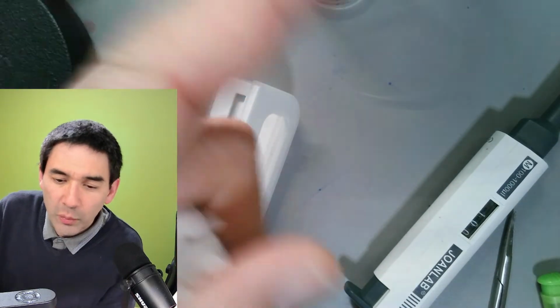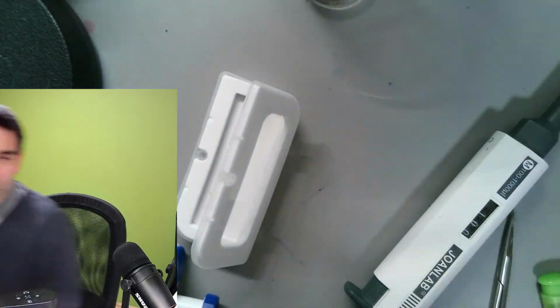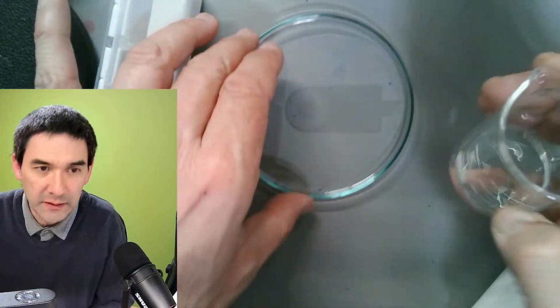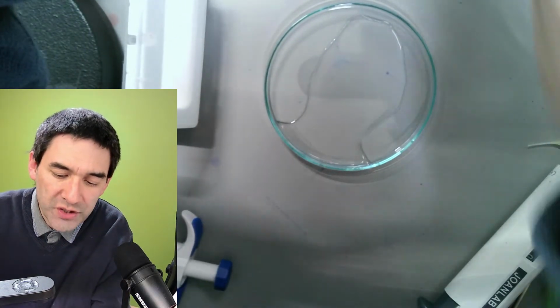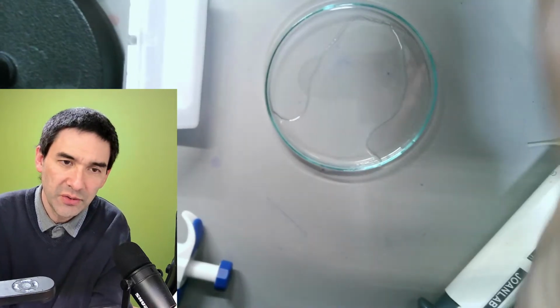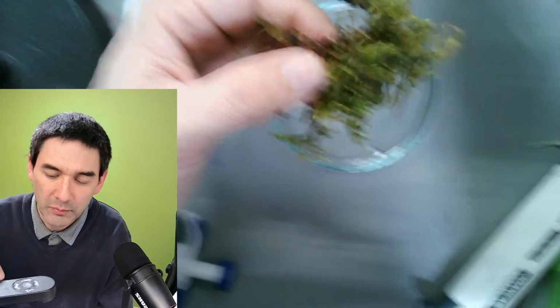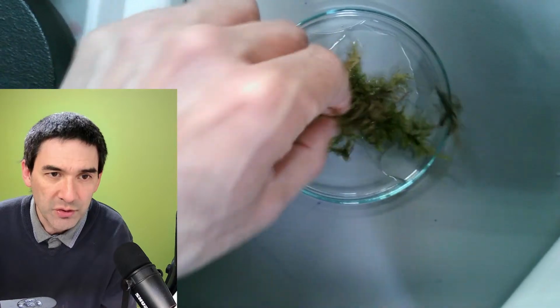Now, as a short suggestion, if you don't want to go all the way with the funnel, I quickly show you an alternative method. What you need is some kind of a Petri dish, and then what you do is the following: you add a little bit of water to the Petri dish. You take some of the moss, and you make sure, of course, that the moss is moist. You have to put the moss into water for a few hours, so that the water bears or microorganisms, rotifers, whatever, basically come back to life, and then that's basically what you do.